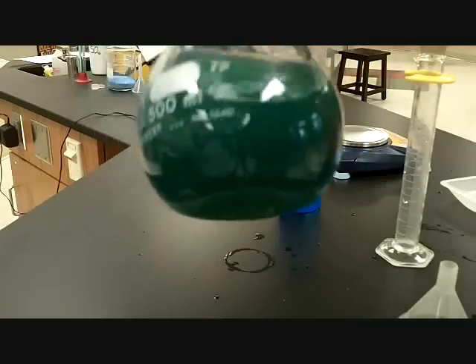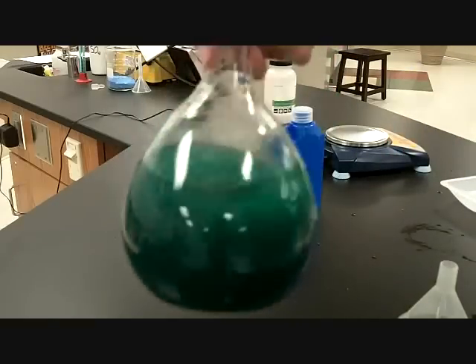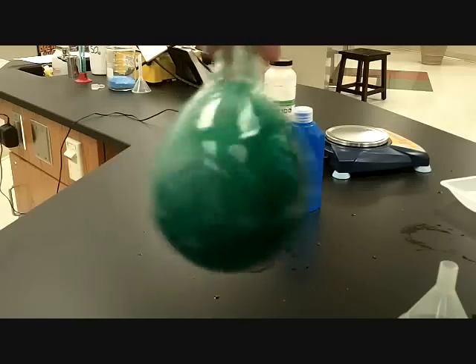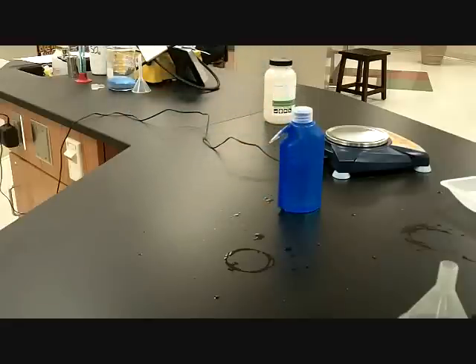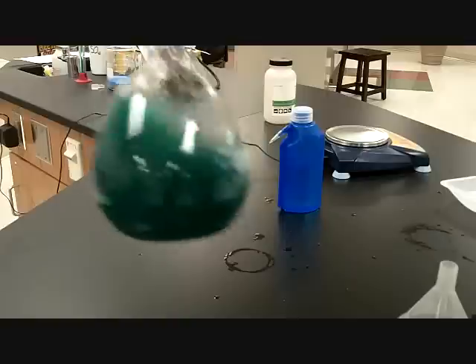Samuel, why don't you go ahead and get some more water here while I'm giving it a little bit of a swirl. Okay, so the crystals are starting to dissolve a little bit more, or dissociate, or break apart. Okay, as I look, it looks like there's just a few more crystals in the bottom of that floating around. Not too bad. We're almost there.